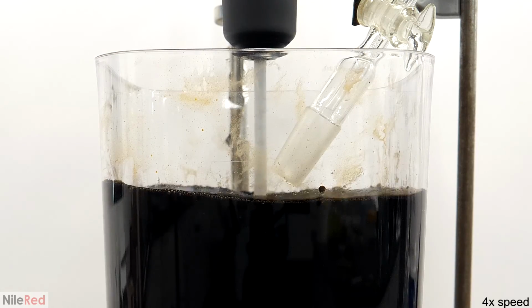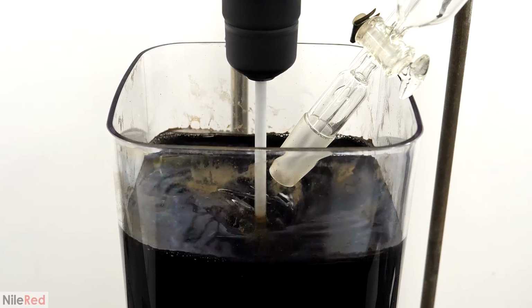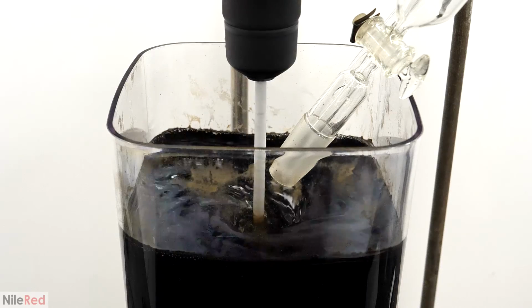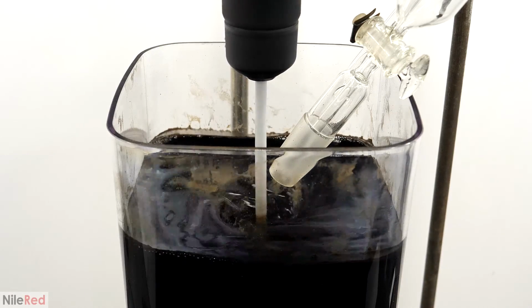Adding the base did cause the mixture to slowly thicken though, so over the course of this, I slowly increased the stirring to around 1500. So 20 minutes later, I was done adding all the ammonia, and then I let it stir for another 15 minutes. While I was waiting though, I prepared the solution that I would use to stabilize the nanoparticles.